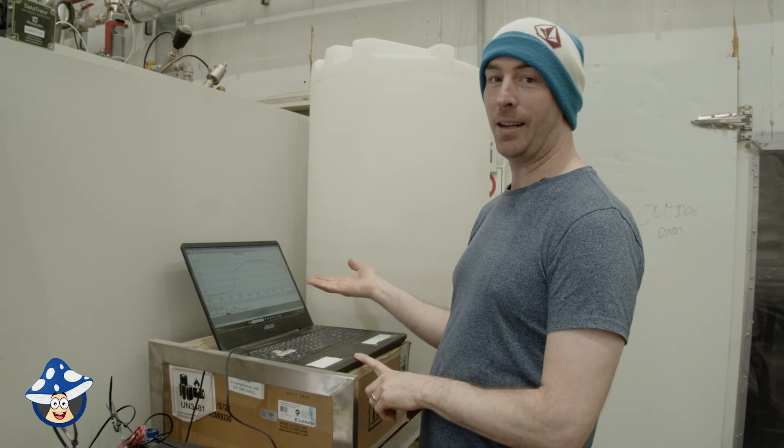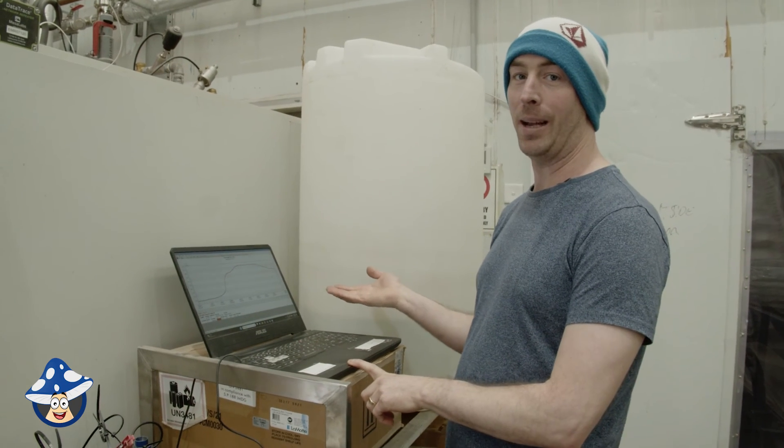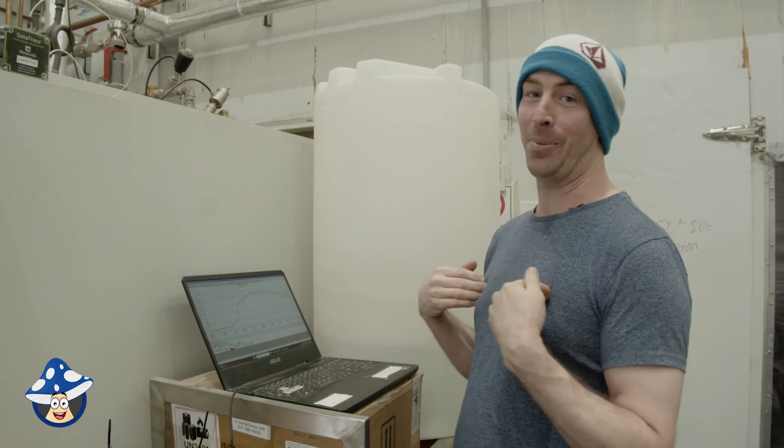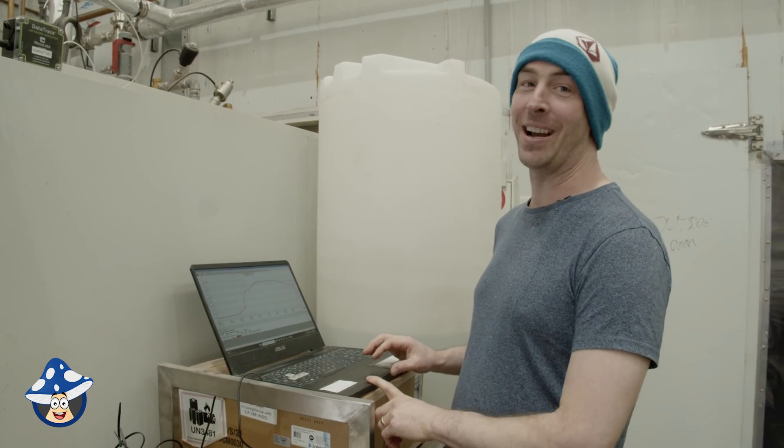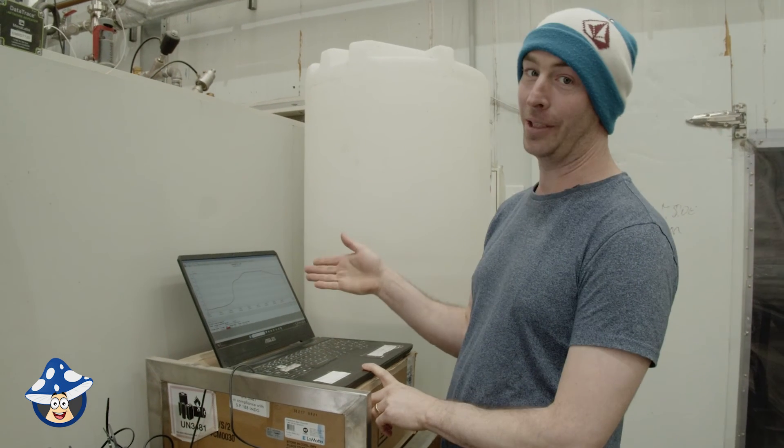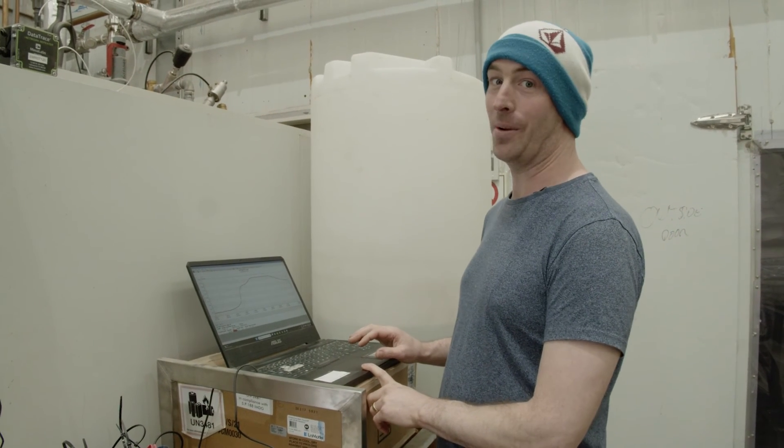it takes a minimum of 15 minutes over 121 degrees to kill everything. And this shows that we did. So happy days. We don't have to bin it and try again. As a wise man once said over in America, if you ain't probing, you ain't knowing. As humans, we don't like being probed, but it's the age of science, so you need to probe. You gotta know what you're cooking, otherwise you've got no idea what you're doing.